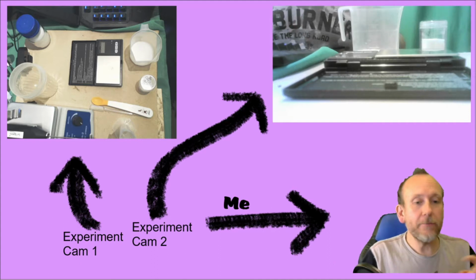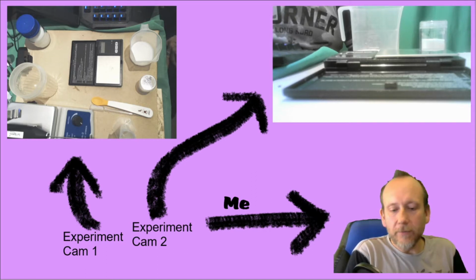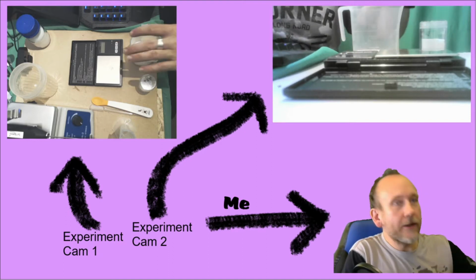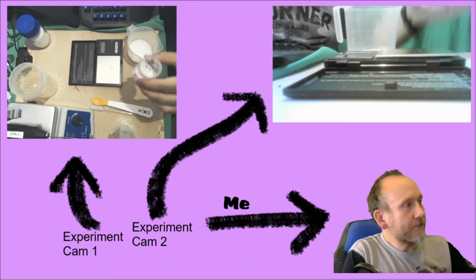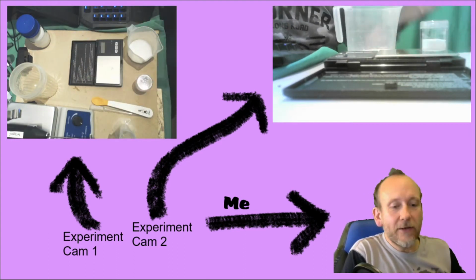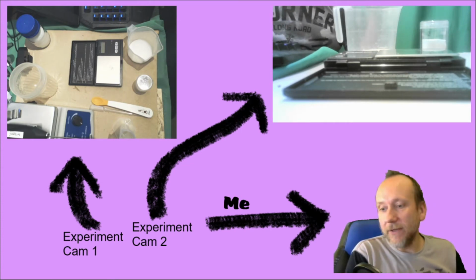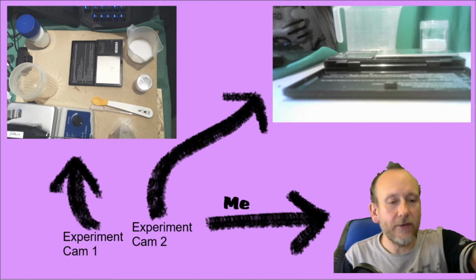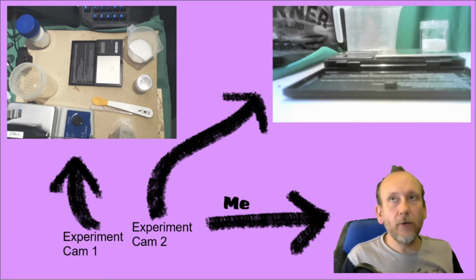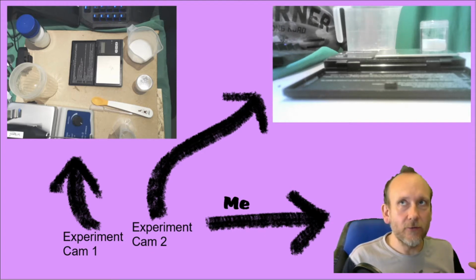I will do this by a mass loss method. Okay, so how are we going to determine the mass of carbon dioxide? We're going to do this by reacting citric acid with sodium bicarbonate, and we're going to do this carefully and weigh stuff out and write stuff down, because if you don't write it down you might as well not have done the experiment, is my credo. I'm going to put the maths into the description so you can follow it, and I'm going to try and keep this to about 5 minutes.